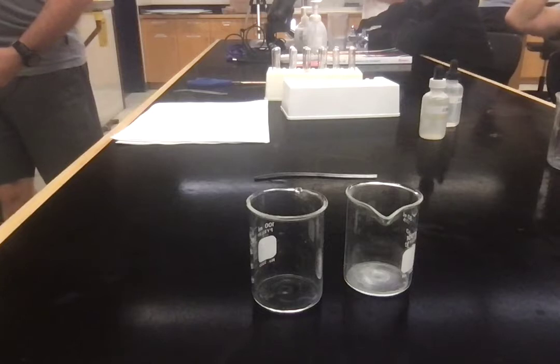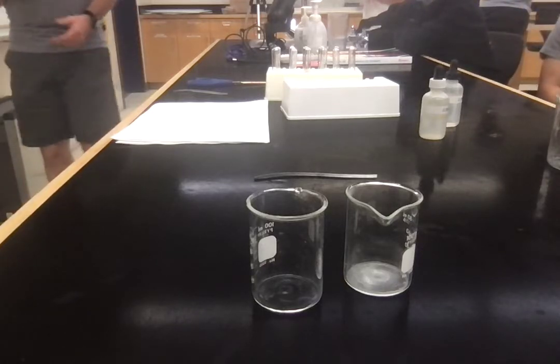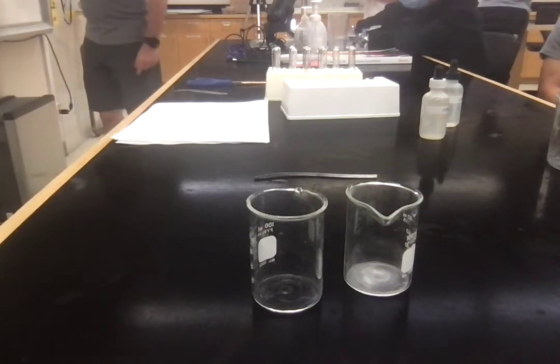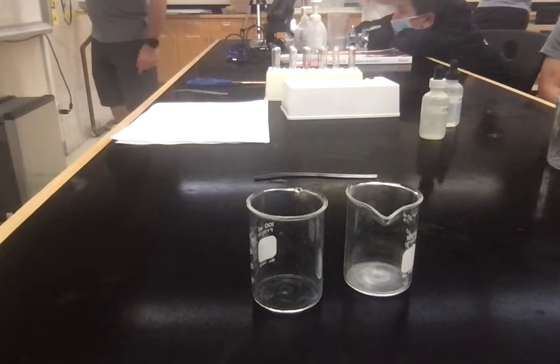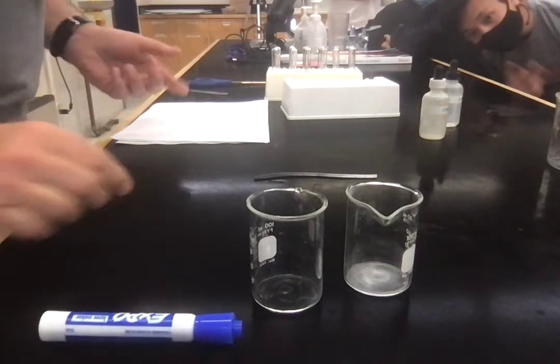And if we were going to go a step further, we would put the state of matter. So this is a solid. This is a solution, so aqueous for solution. You will find, and I'll show you, this is a solution, and this is a gas. Okay, so there we go. That's a full chemical equation. And this is how I'm going to do the experiment.